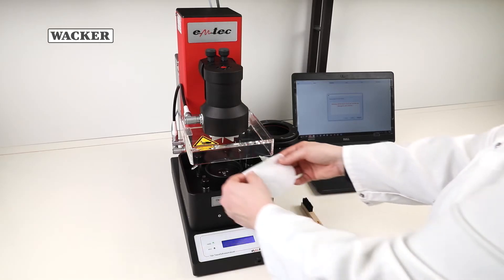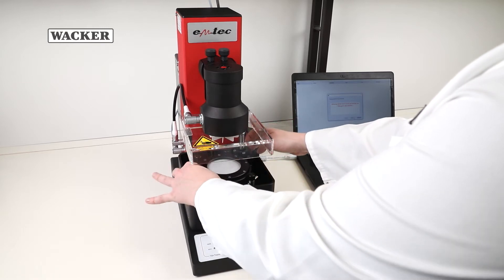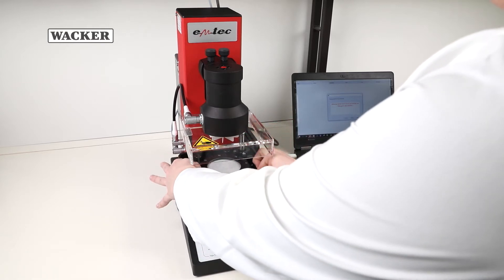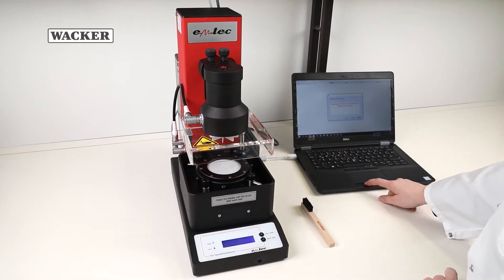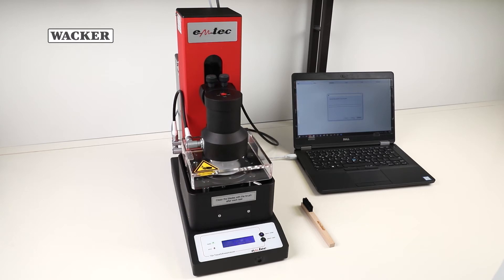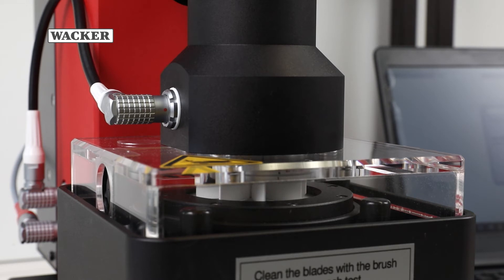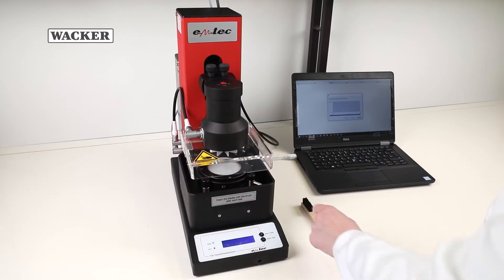The operator then places the specimen in the ring of the TSA and locks it firmly in place. The motorized arm positions the rotor precisely over the sample tissue, using rotary motions and pressure to measure the softness of the surface, the roughness of the protruding fibers, and the stiffness of the tissue.